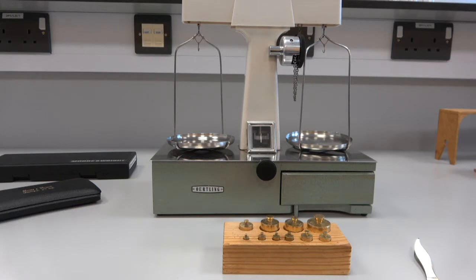So we literally just put a mass on one pan and balance it with masses on the other pan. And it might not seem very accurate.